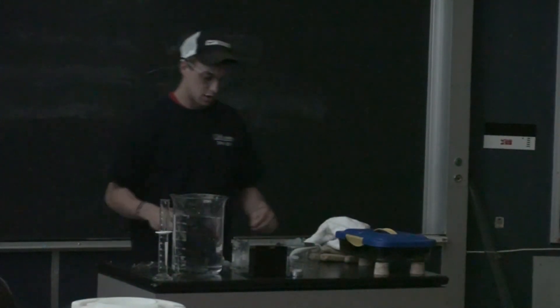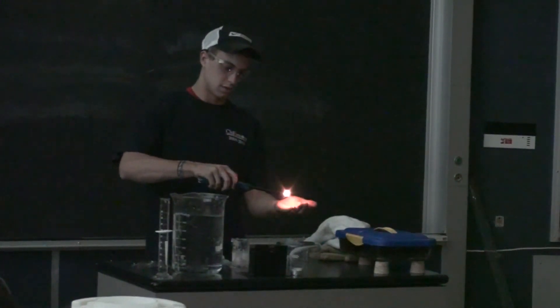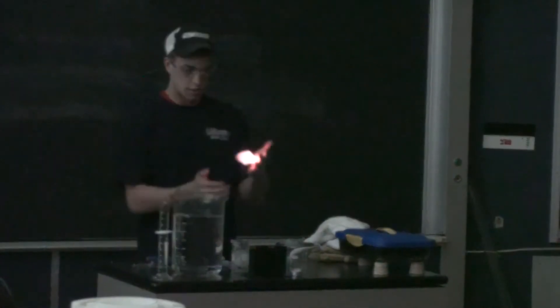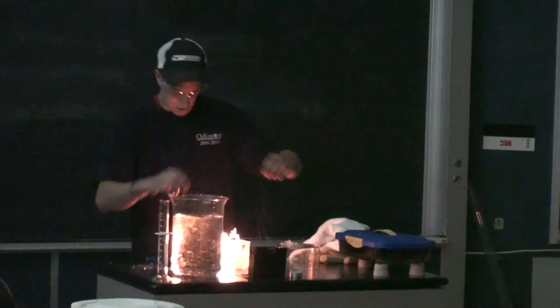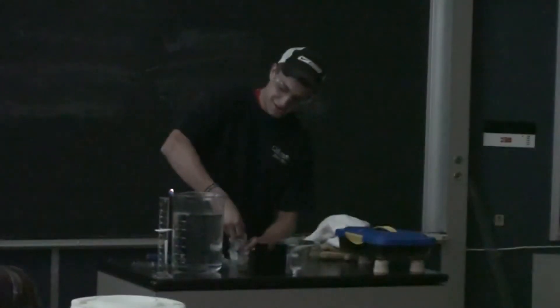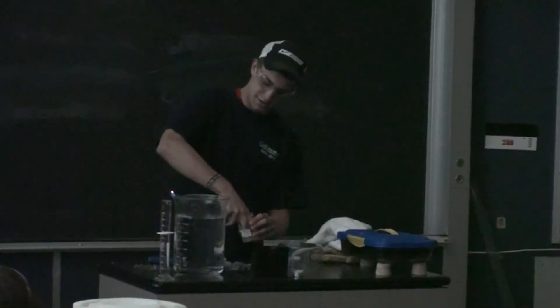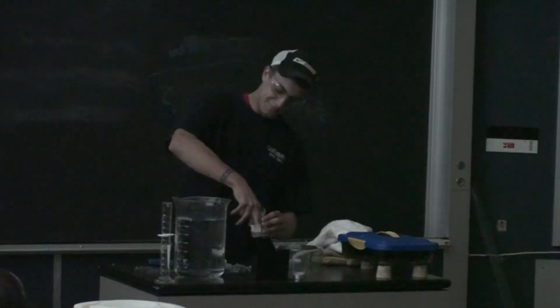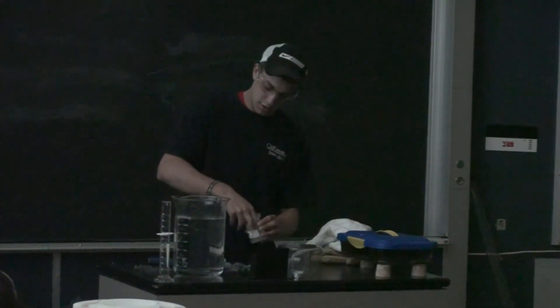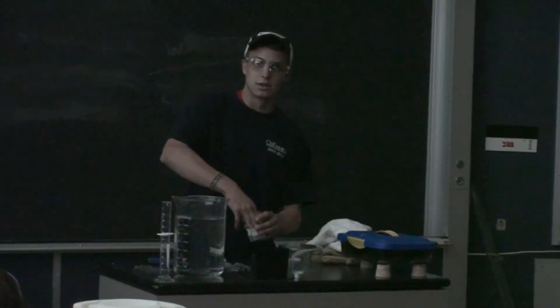Okay. Now I will pick up the colloid. Oh shoot. And I can pass it back and forth. Woo. Kind of. Not over the excess. Not over the excess. It's really liquidy. I don't know why that's happening this time. But anyway.